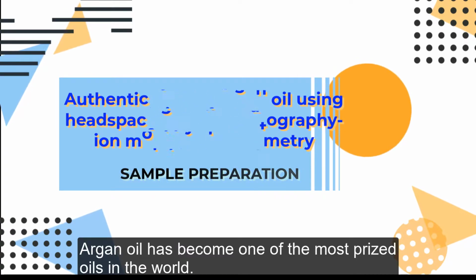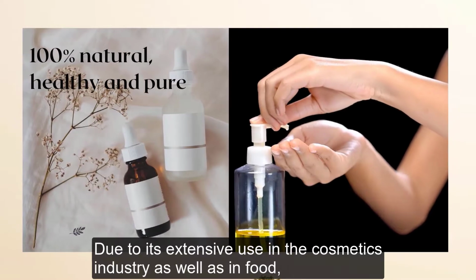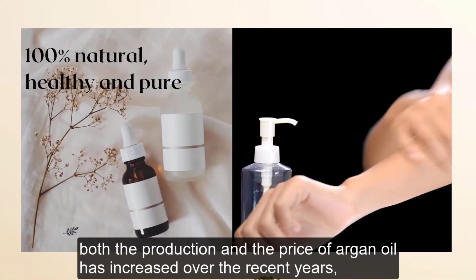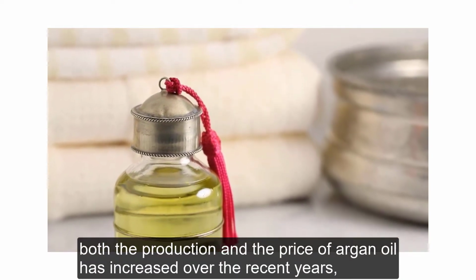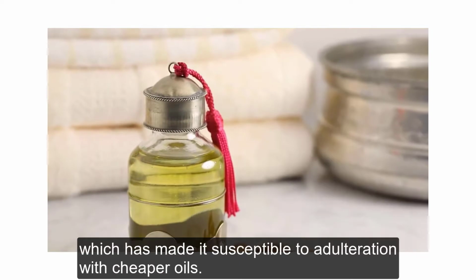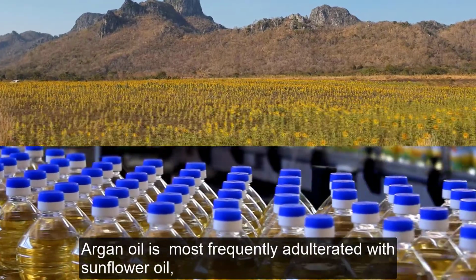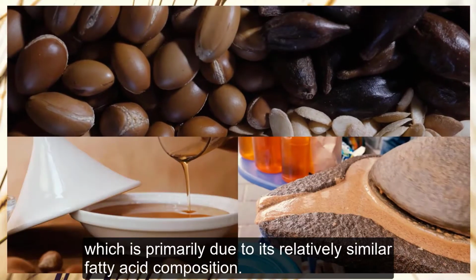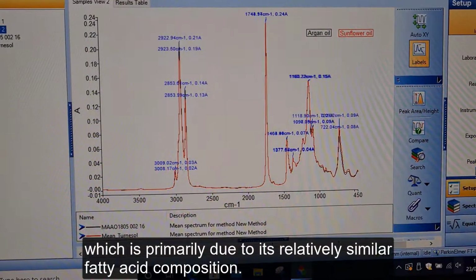Argan oil has become one of the most prized oils in the world due to its extensive use in the cosmetics industry as well as in food. Both the production and the price of argan oil have increased over recent years, which has made it susceptible to adulteration with cheaper oils. Argan oil is most frequently adulterated with sunflower oil, which is primarily due to its relatively similar fatty acid composition.